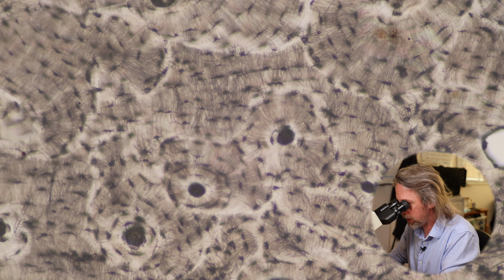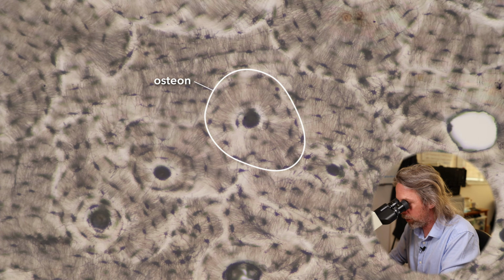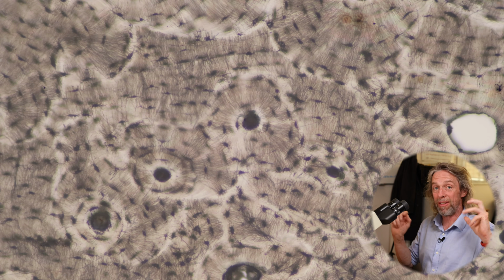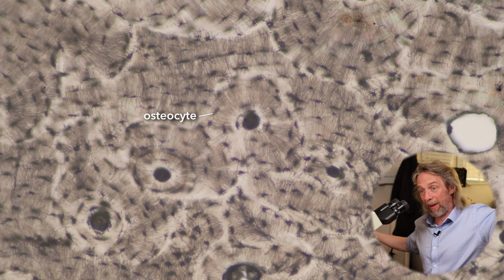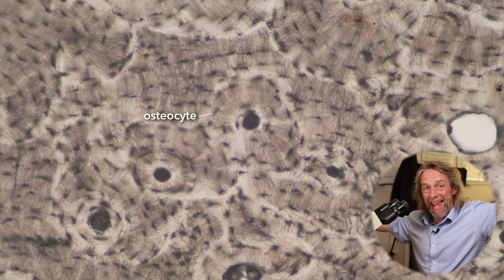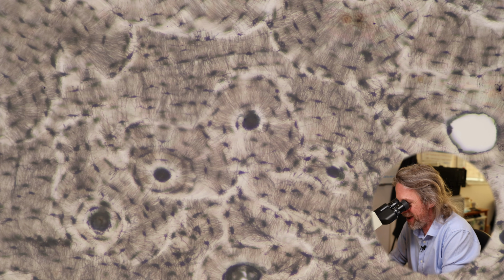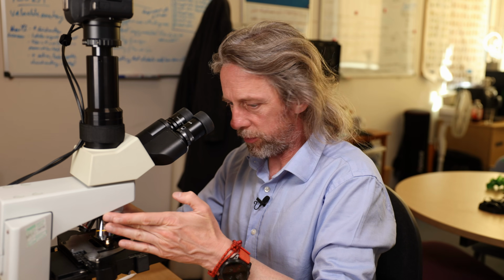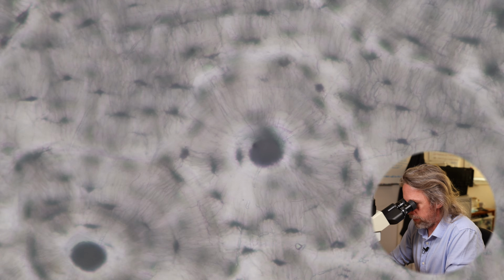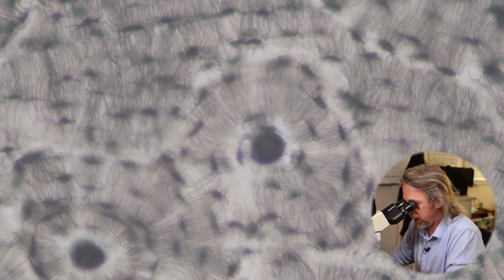And can you see those circles again? That's the osteon, that's the Haversian system that we're looking at. And now we can see the osteocytes within their lacunae, but we can see the osteocytes sending out cytoplasmic processes. So they're not sat there within that lacuna, they're sending these processes out, and they're connected to each other, and they're communicating with one another. Doesn't this look amazing? Right, let's jump up to 200 times magnification. It's probably going to be the sweet spot. You can see I can focus up and down quite a way, so it's a thick-ish section.